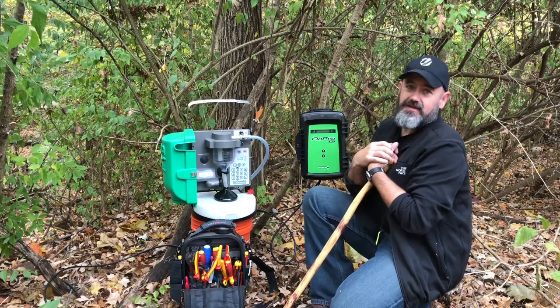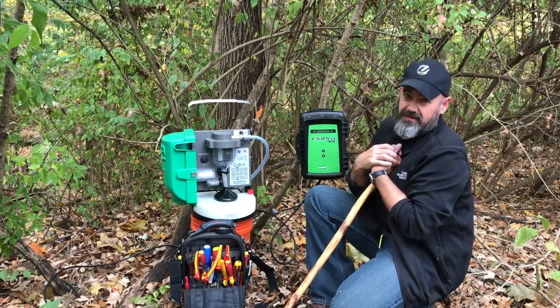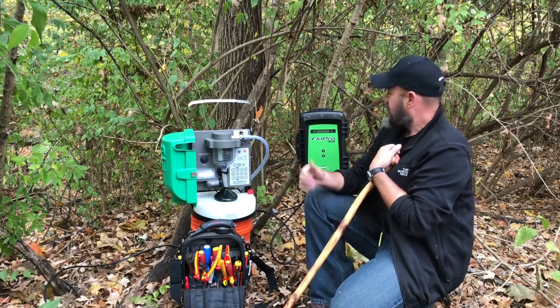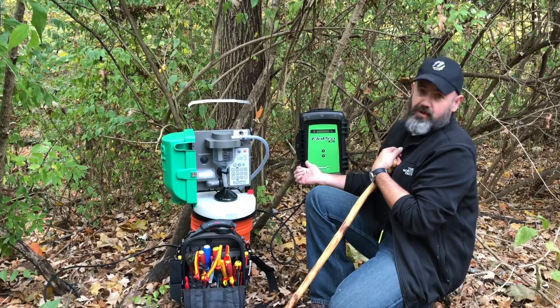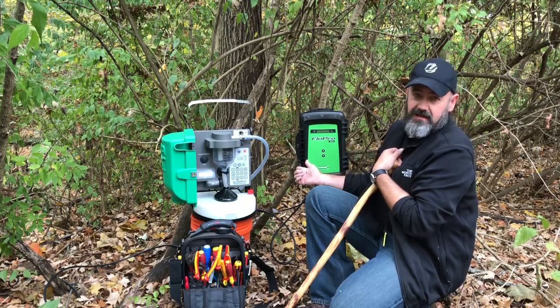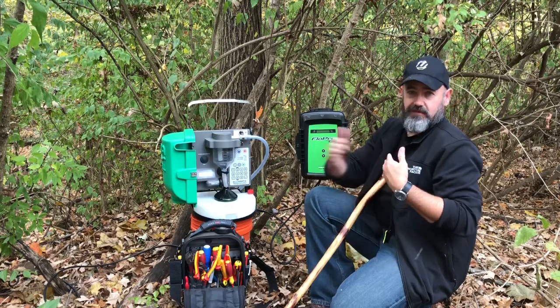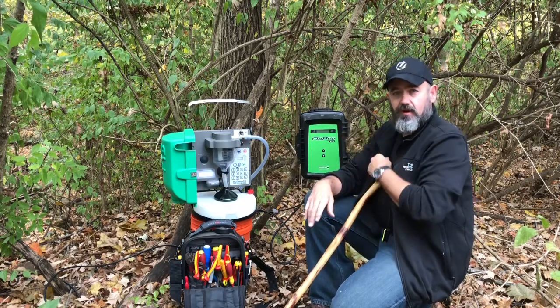I've gotten a lot of questions about what a typical flow meter and sampler setup looks like, so I thought I'd just show that off to you today. This is a MACE Flow Pro XCI. This is mated to a Doppler velocity head, and what that does is measure the velocity of the water as well as the height of the water column.